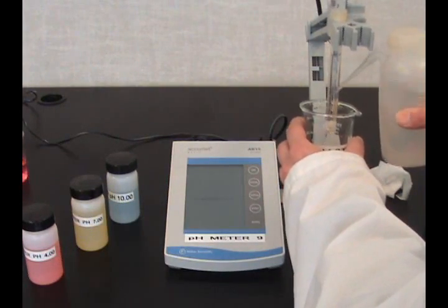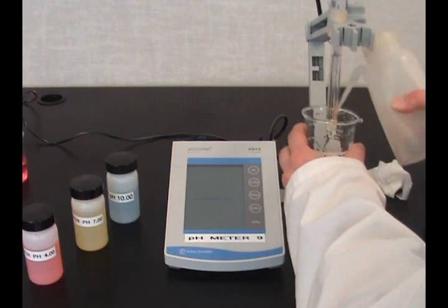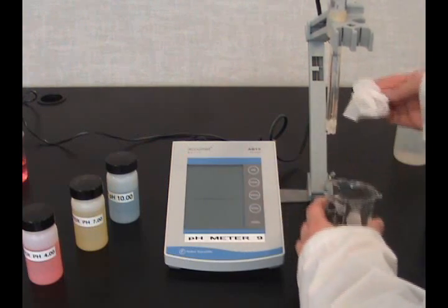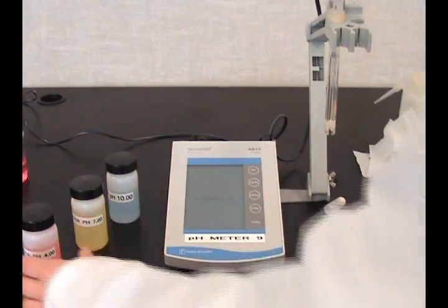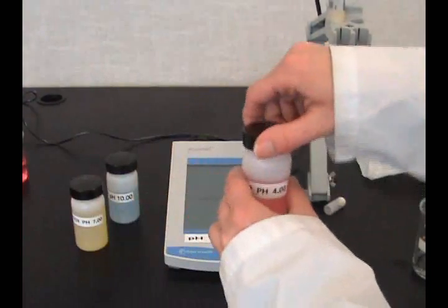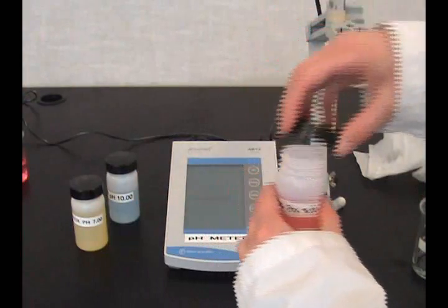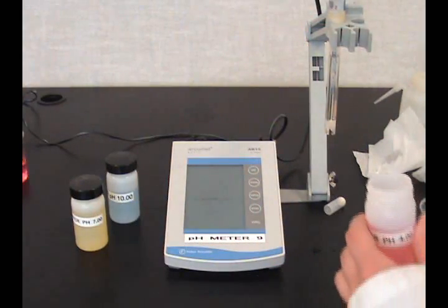Rinse the probe with distilled water to remove the buffer solution. Blot dry. Choose another buffer, preferably 4, and repeat the standardization.